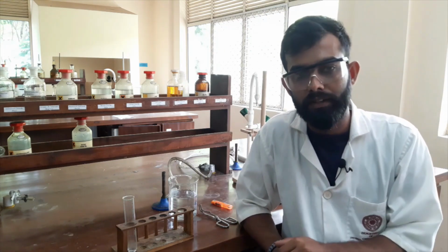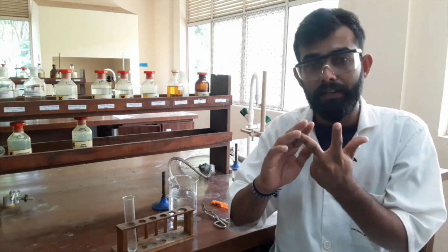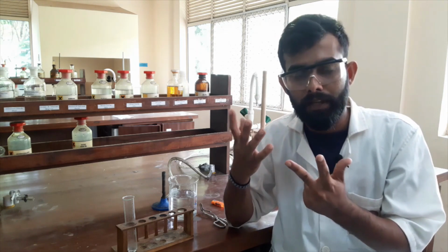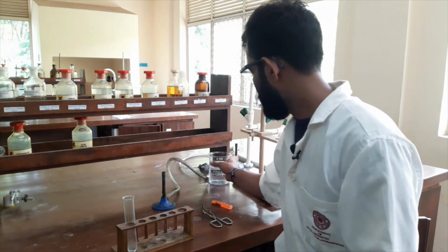There are three qualifications to be a suitable solvent. First, the compound should not dissolve in the solvent at room temperature. But while heating, it should dissolve. But after that, when it comes back to room temperature, crystals should reappear. If these three things are fulfilled, we can say that particular solvent is the suitable solvent. Now we proved that water is the suitable solvent.